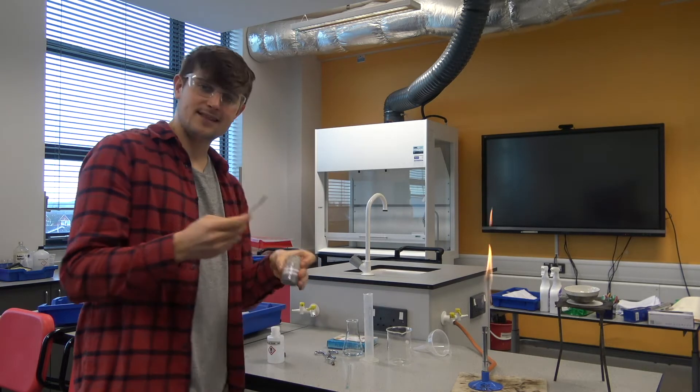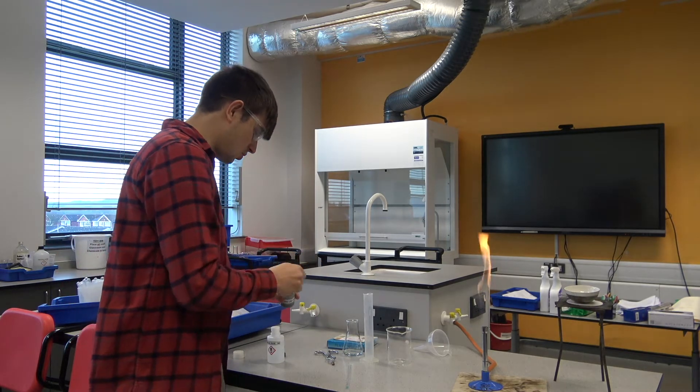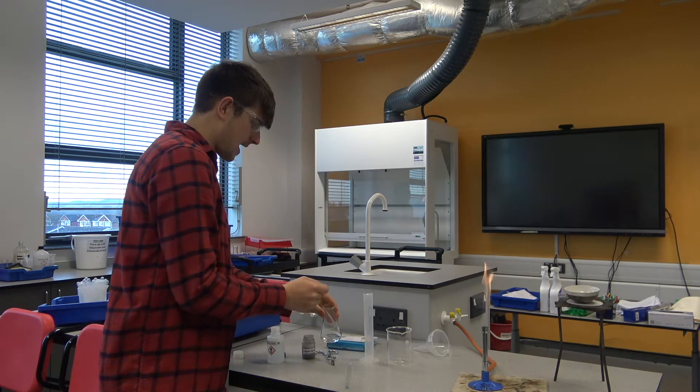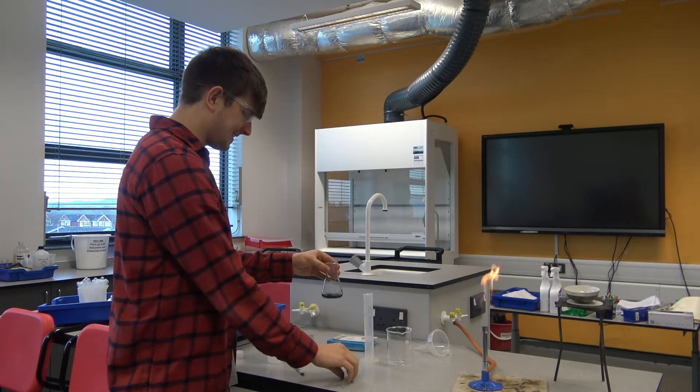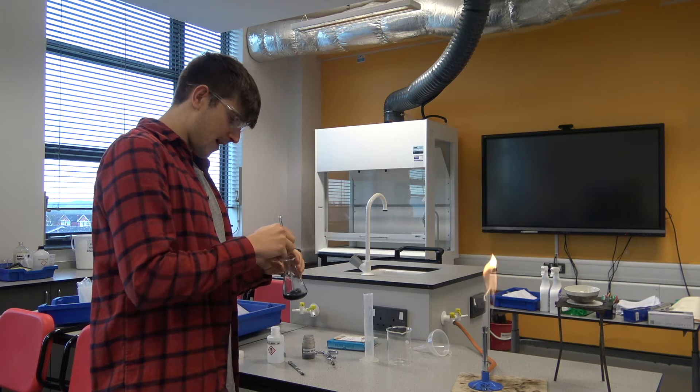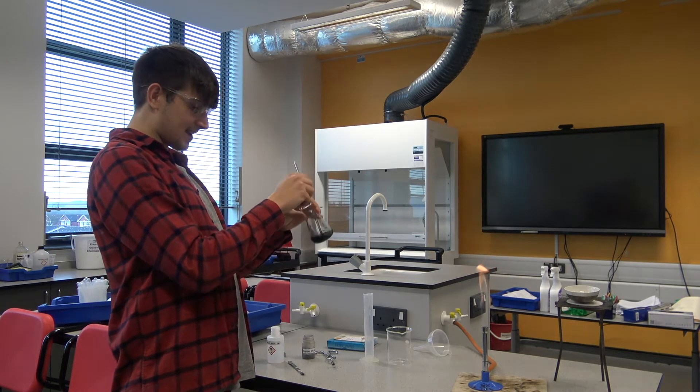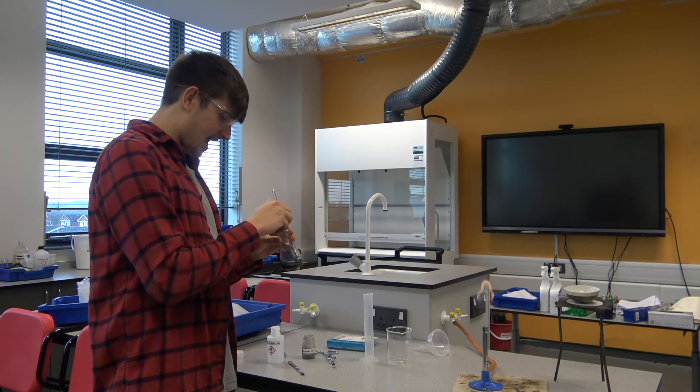The next stage is to add this copper oxide to my sulfuric acid. We're actually going to add it in excess, and what I mean by excess is to make sure that all of that sulfuric acid has reacted.